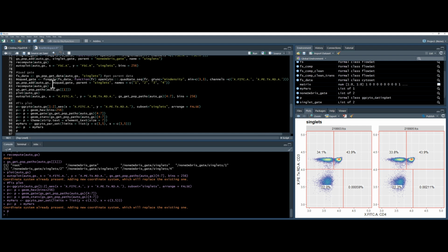So at the moment, because we're using fs apply, each file is getting its own analysis looking at density, which might not be ideal, and in a better world you'd be using your controls. So you would do this automated method on one file and apply it to all the subsequent ones.